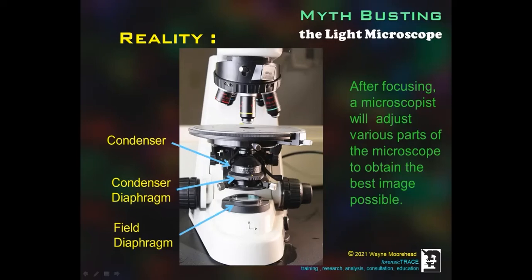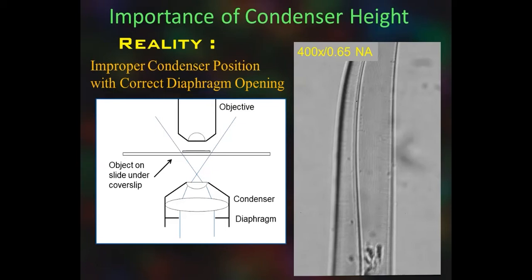The proper setup is called Kohler illumination after the microscopist who invented it. To give an example of a microscope that is not properly aligned, the image on the right is in focus, but the condenser is not correctly placed. The condenser is not focused on the specimen as seen in the diagram on the left. The blue lines in the diagram show the ray tracings of light through the condenser and specimen, showing that not all of the light is entering into the objective. You can see that the focal point of the condenser is below the specimen, thereby not providing proper light to the specimen. The punctae, or tiny dots, in the diatom are not visible, but merely implied in this fuzzy image.